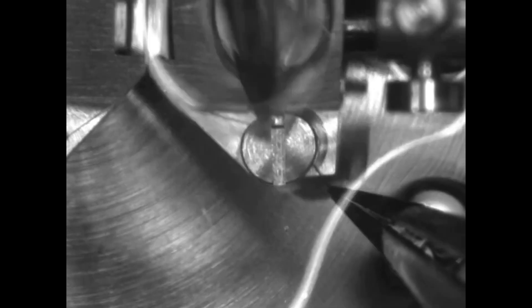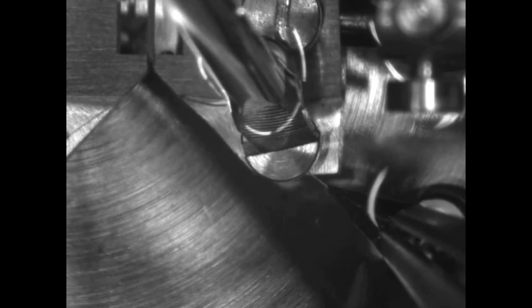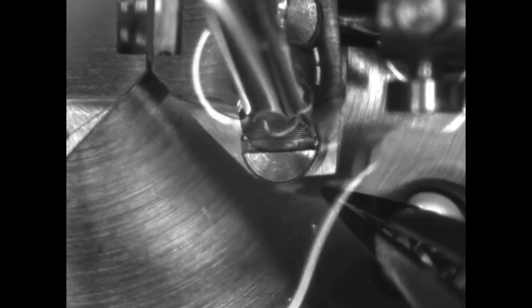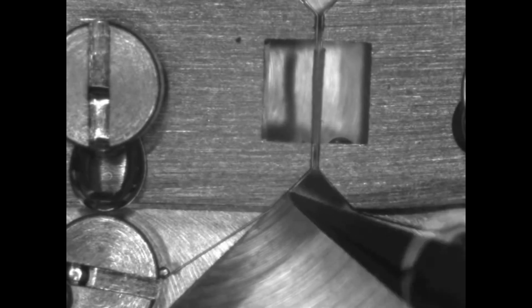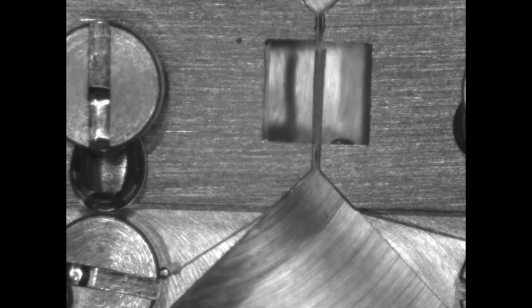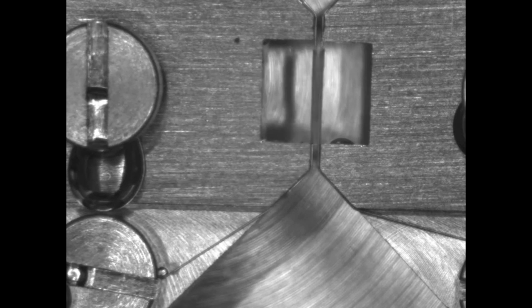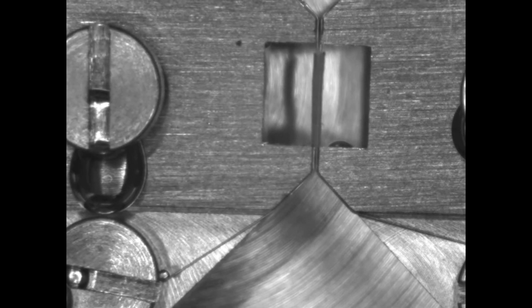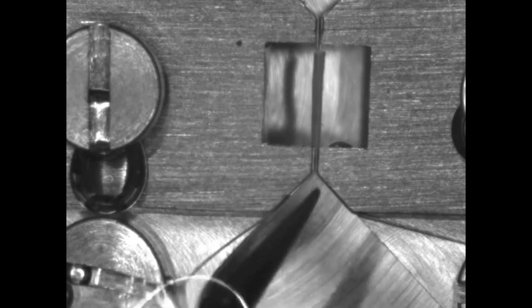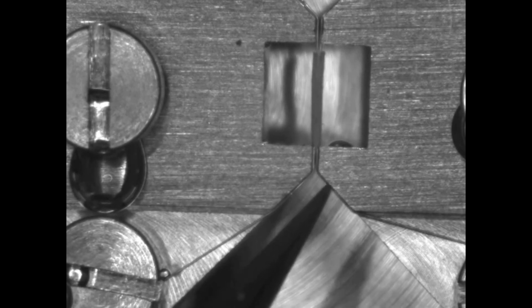Now close the jaws and secure the first side around one of the screws. Add a small gap between the jaws so you can grab the back half of the wire and eliminate any slack. You can move the jaws a little to let the vessel fall in place. You should use your forceps to lightly press down the wire on all four corners — this will ensure that your wires are at the same height all the way around.